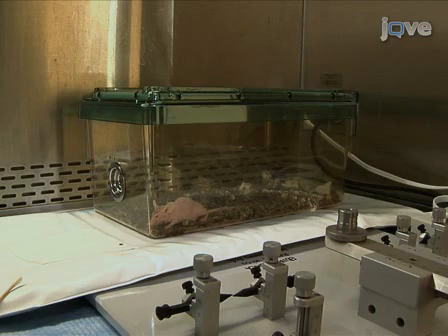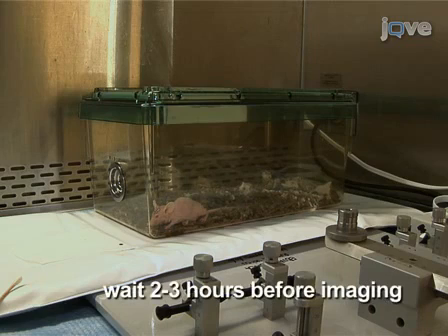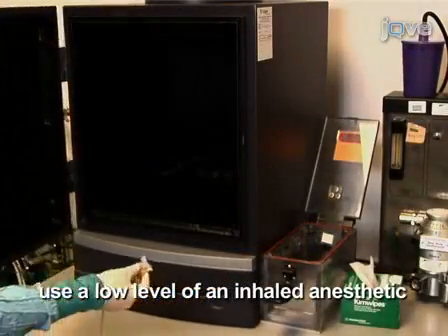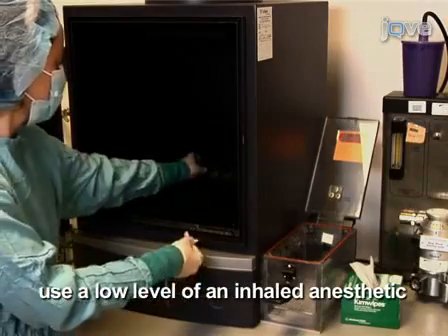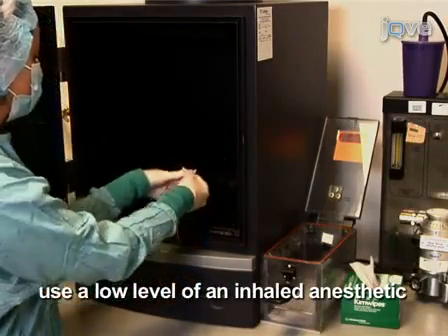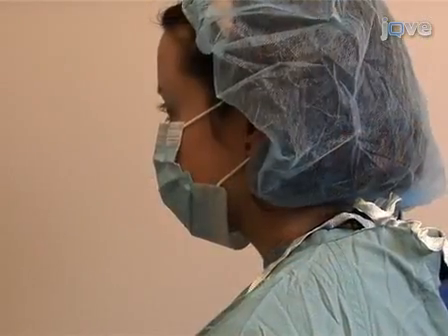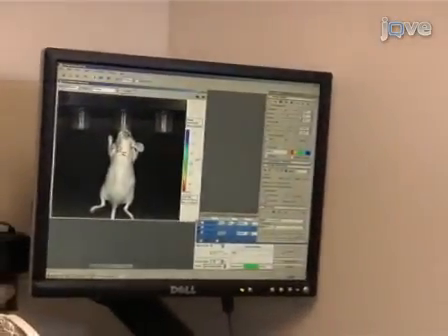Due to the length of the procedure, it may take up to an hour for the mouse to regain full activity. If imaging will be performed, it is best to wait 2 to 3 hours. To perform imaging of fluorescent-labeled infusate following CED administration, position the anesthetized mouse dorsal side up in an imaging station. Using an appropriate filter setting for the fluorescence that is being imaged, acquire an image.